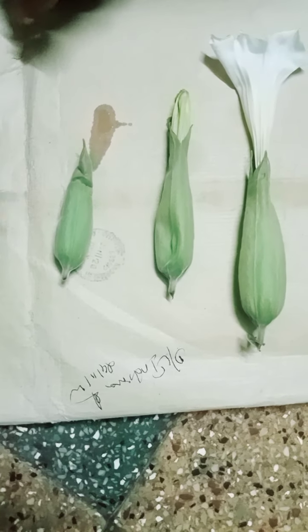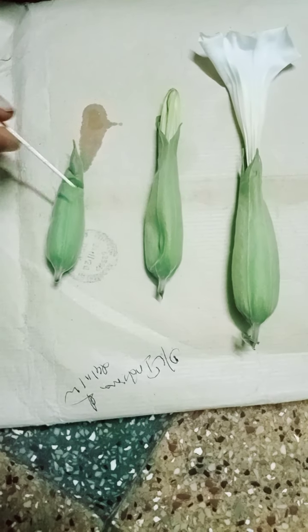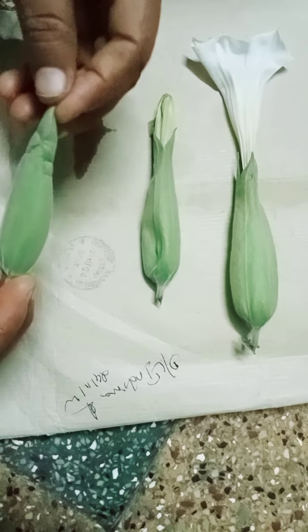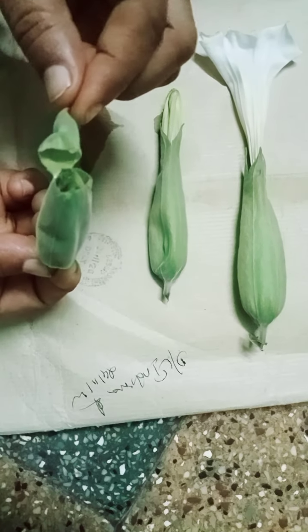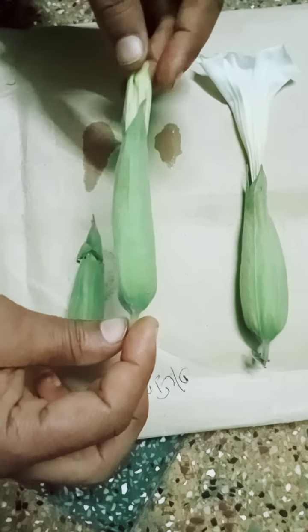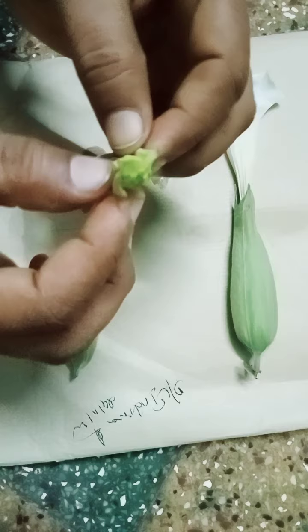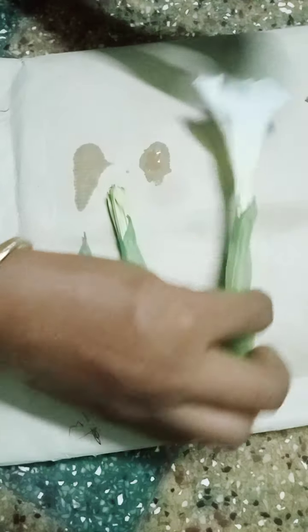Welcome to the biology class. I have taken the different stages of Datura flower. This is the bud condition of the flower. The bud is protected with the calyx part of the flower — it is fully covered with the calyx, so you couldn't see the other parts. This is a somewhat mature flower. You can see the calyx part and the petals — the petals are curled in nature in the bud condition.